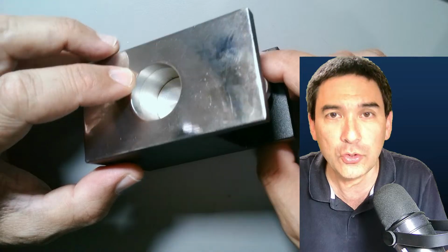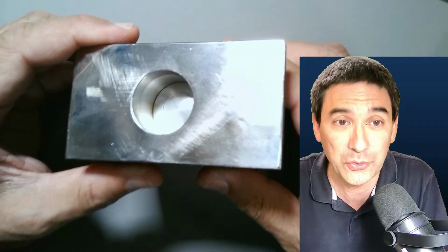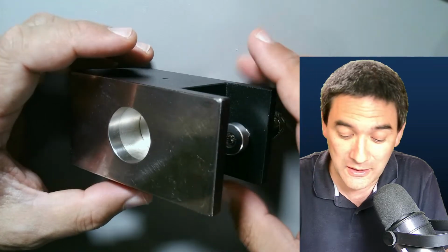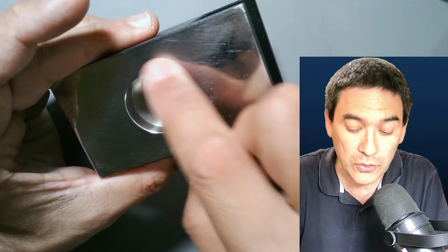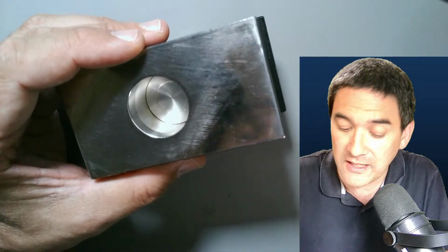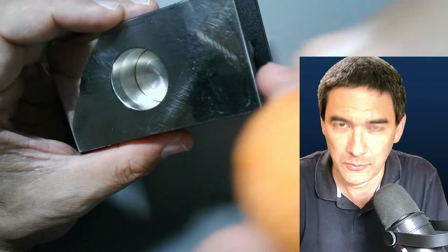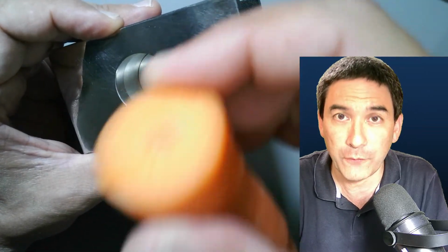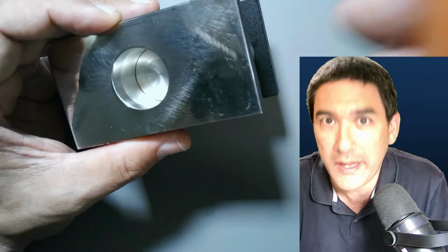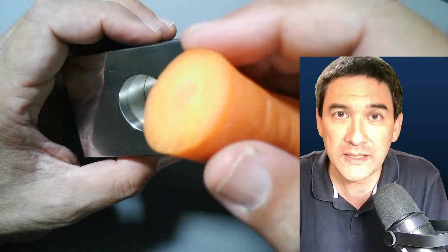Okay, so what I would like to show you now is that I'm still also learning how to use this device. So if you have any suggestions on how to improve it, please comment on that. What I'm going to do now is try to fit the carrot. The carrot will also be our specimen holder. It will all be clear, and I will show you first the wrong way.